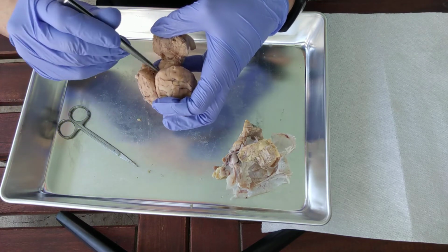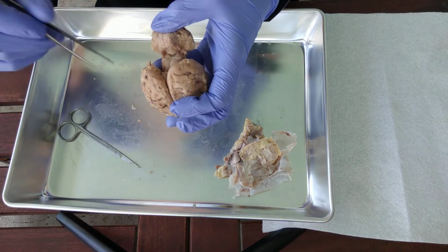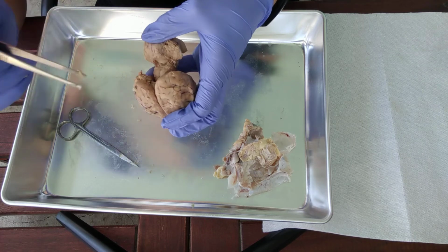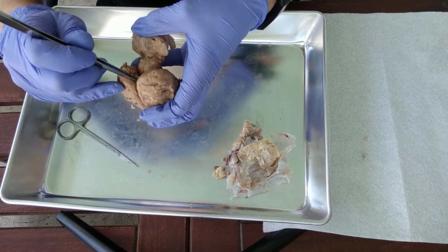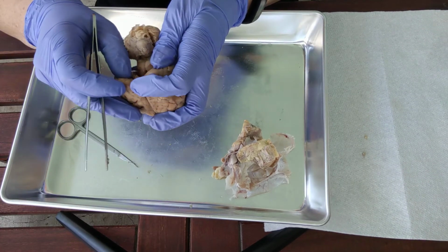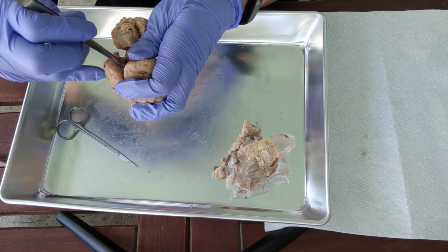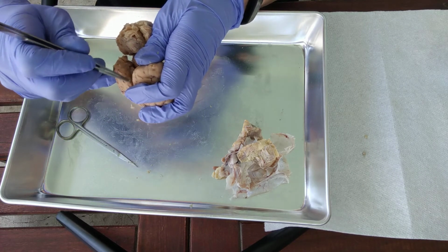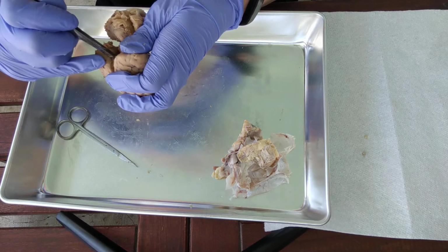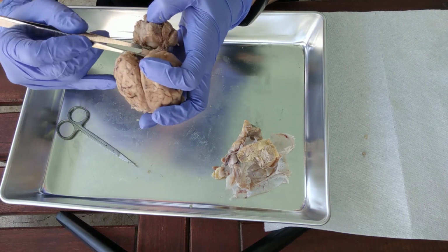And if you break through the tissue here, and it's just arachnoid matter, we can remove all that. You'll notice this little pea-like structure right up in there. See the little pea-like structure deep in there? That's the pineal gland. Okay, so that right there is the pineal gland. That's going to monitor and affect your sleep cycles. Releases melatonin. So pineal gland in there, corpora quadrigemina.